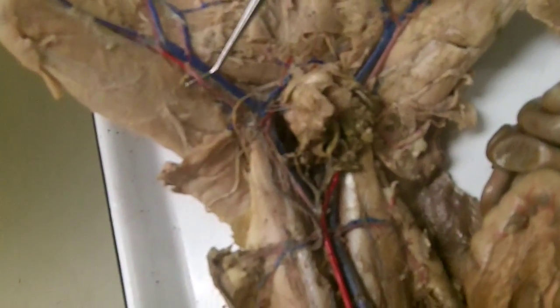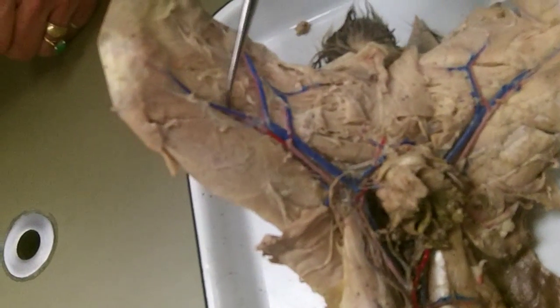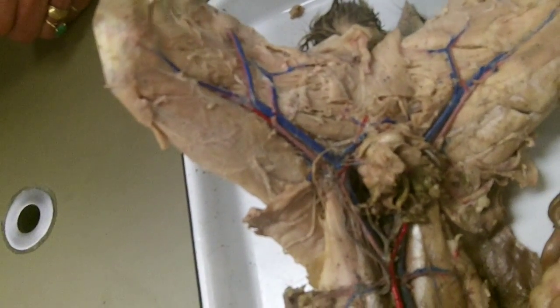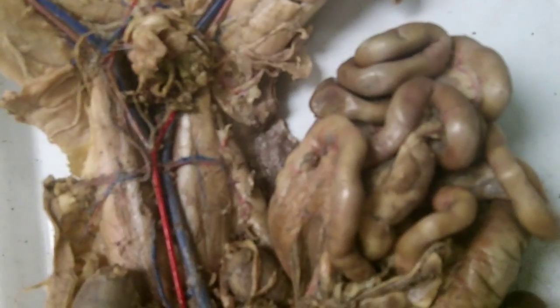All right, so then once we get the external iliac crossing the inguinal canal, then out here we call it the femoral artery. And then once you see this diving into the knee, we want you to call that the popliteal. And then it continues on as the saphenous artery. Now, if I'm going to do this again with the veins, let's stop.